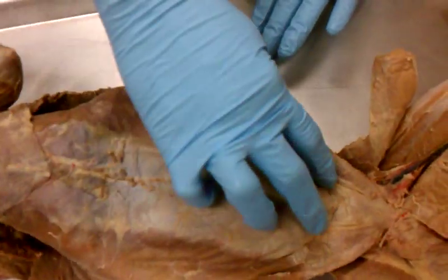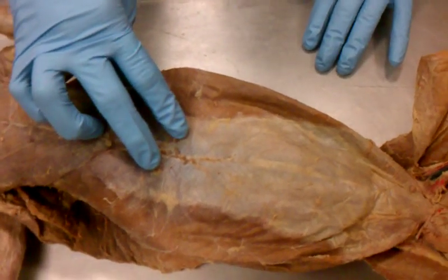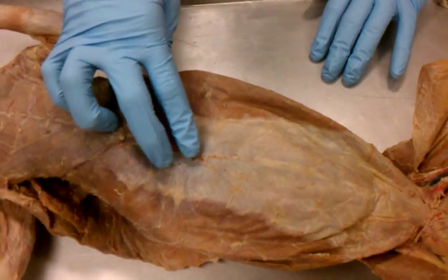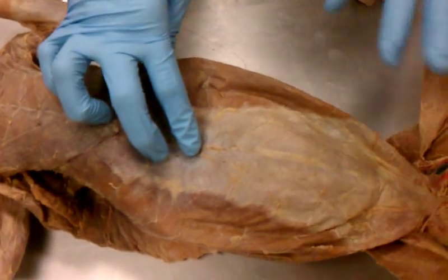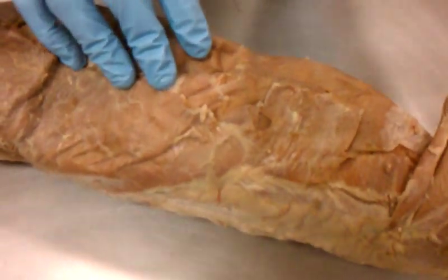What are the ones that make your six pack? Abdominal. Yes, but what are they called? Okay, give me a second. I'm going blank. On the side here, you have the other parts of your abs.